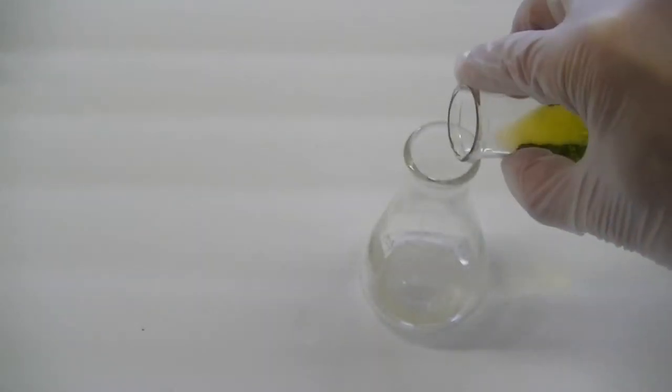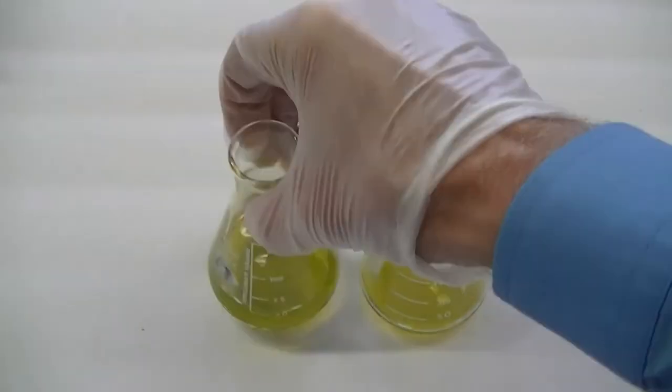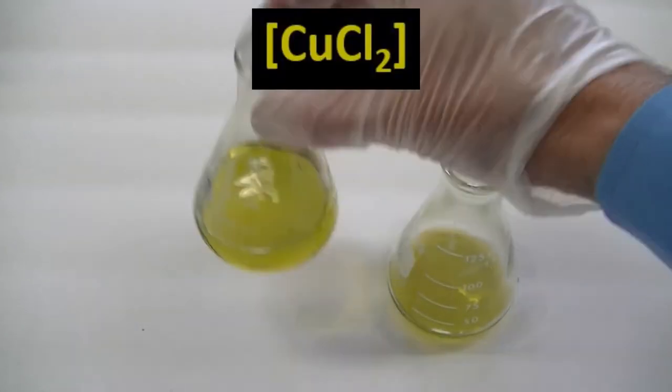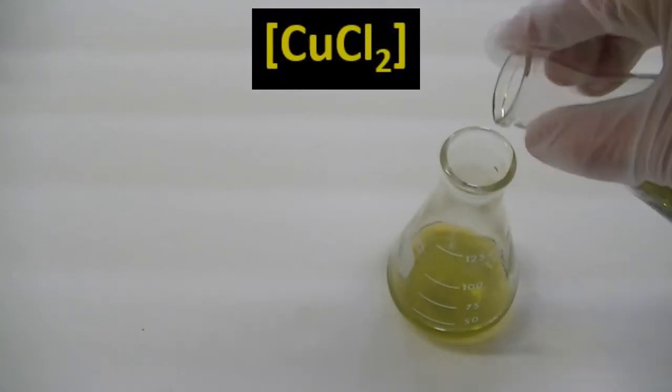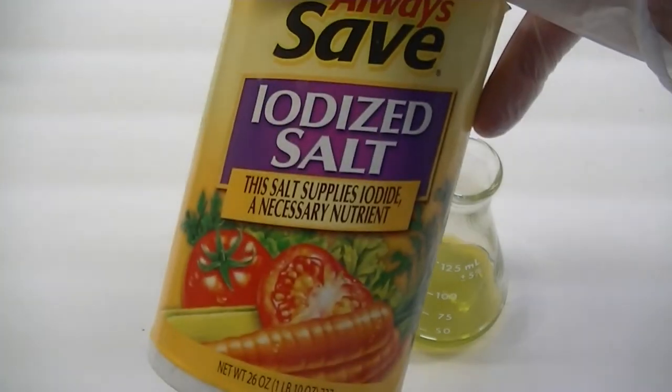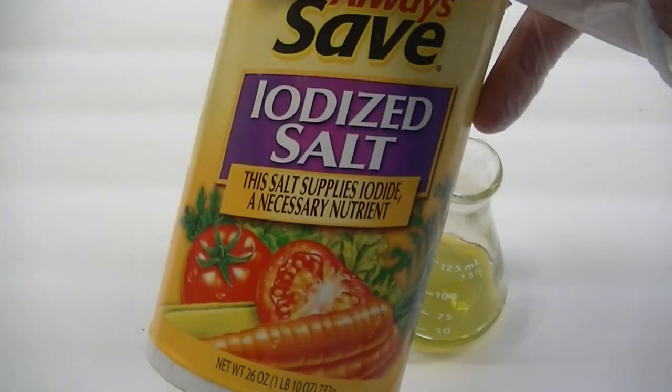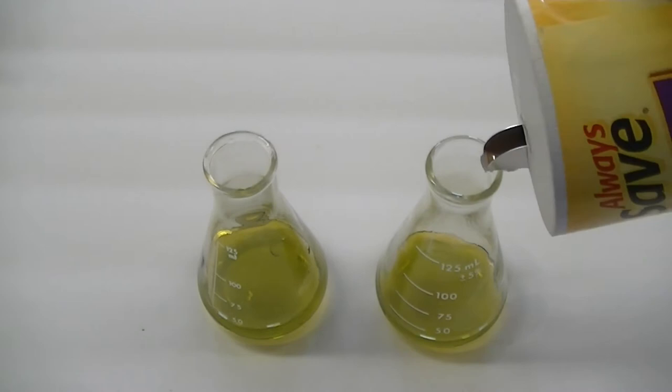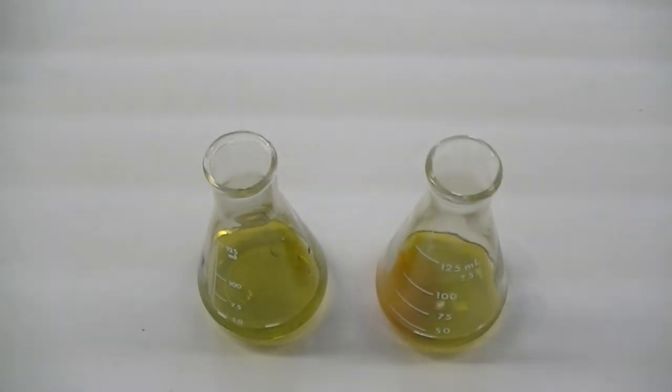Let's begin our experiments with some of the copper-2-chloride dissolved in acetone. Notice that the copper-2-chloride in this case has a dirty yellow-green color. Now to this flask on the right, we're going to add a whole lot of salt. This will substantially increase the chloride concentration in the flask.